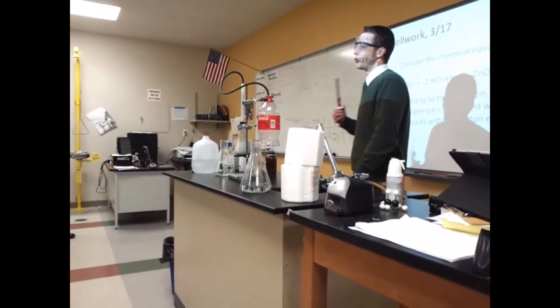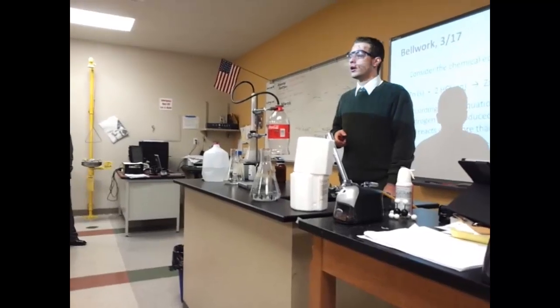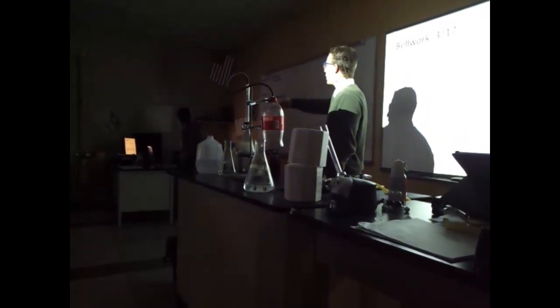Bottle should be, theoretically, full of hydrogen gas. So Anastasia, I will ask you to take the lights down for me, please. Jamil, if you'll go over there and press the B key on the keyboard, please. Don't do it yet. Your laptop or the... On the, yeah. That's going to make the screen go black.